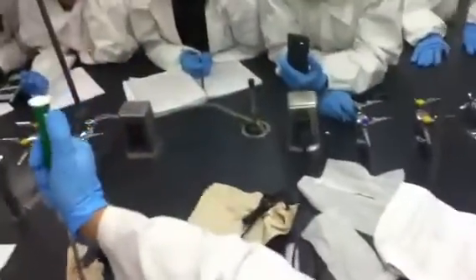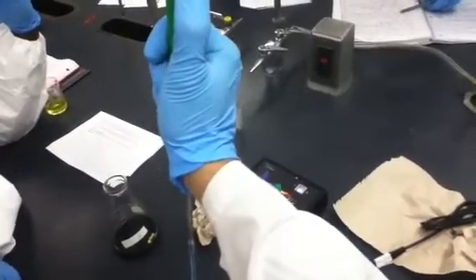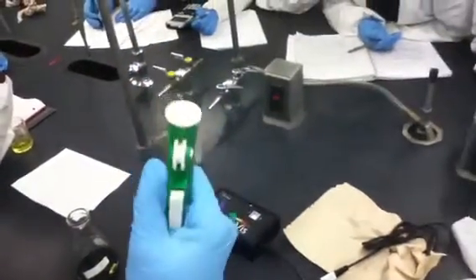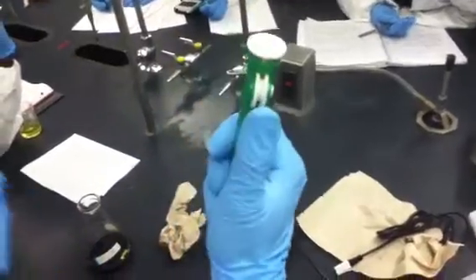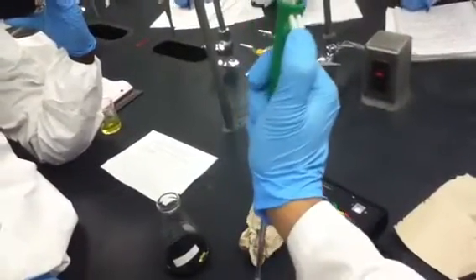I diluted with the toluene since I'm not using toluene anymore. So I'm just making use of the toluene that I have in this case, right? Okay, so in our case, we wouldn't do that. That's what you're testing, which one you should do, either water or toluene. If it's water, you don't need to do it. So you diluted the experiment mixture more, right? It was concentrated in this case. Remember, if it's concentrated, light will not pass through. Maybe it's still too concentrated.